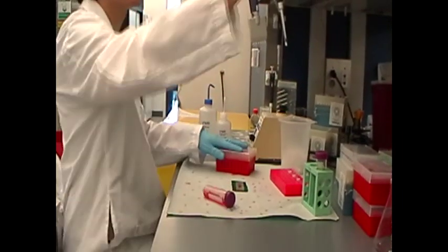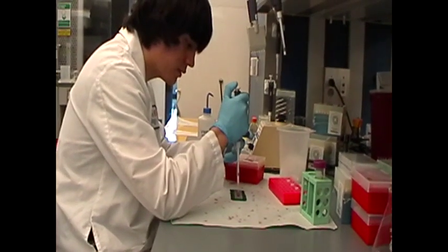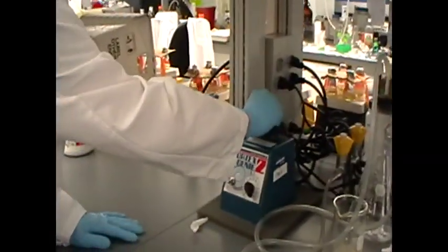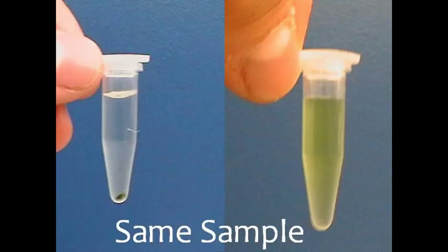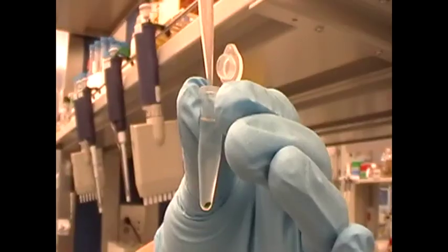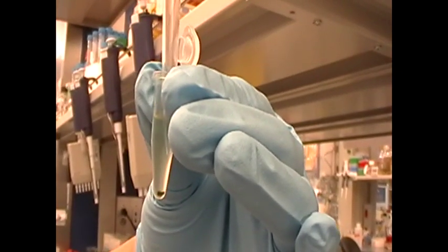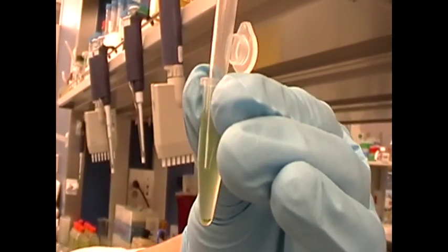The first step is to load the sampling area of the hemocytometer with 10 microliters of your cell sample. Adjust the setting on your micropipette to read 10 microliters. Now, vortex your sample for approximately 3 seconds before loading it. This is important to ensure that cells are suspended in the solution rather than concentrated in one area. In order to approximate cell density, it is important to load a representative sample. If you do not have a vortex on hand, you can also gently pipette the sample.